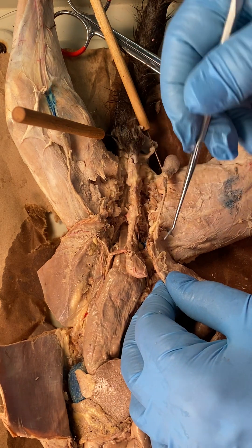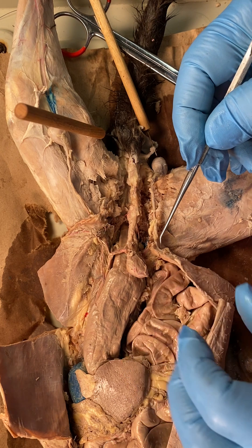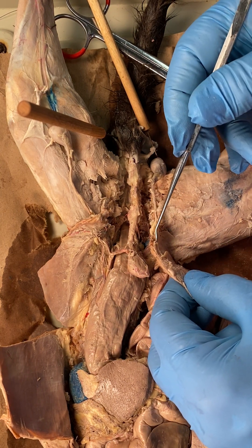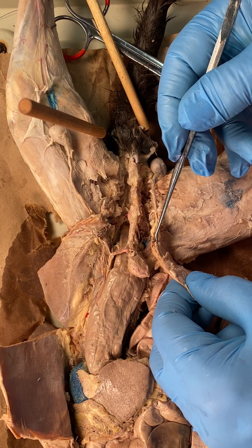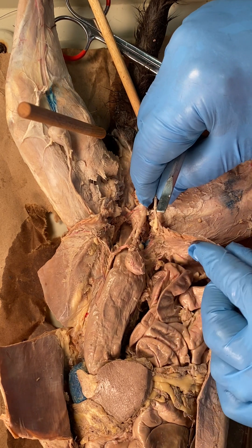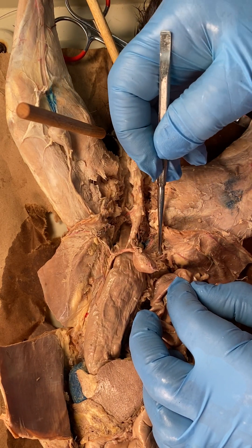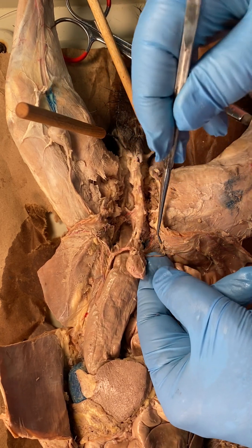The spermatic cord has to get through the peritoneum — the parietal peritoneum and then the visceral peritoneum. How does it get inside? Through the inguinal canal. When it gets to the other side, the blood vessels and the vas deferens come out on this side.